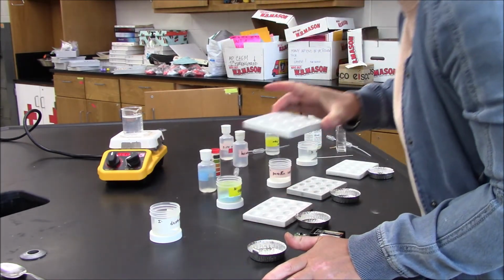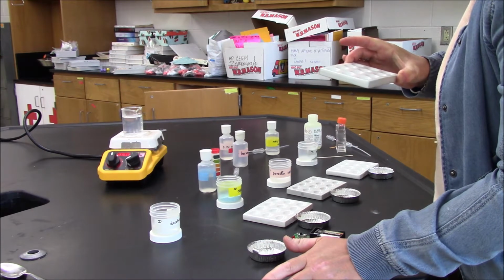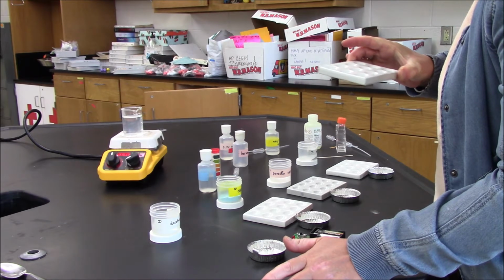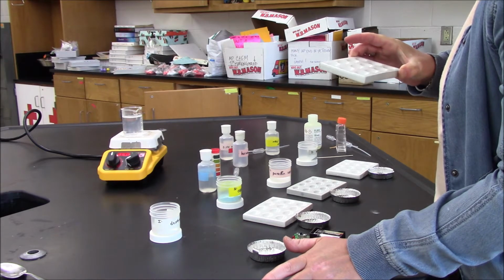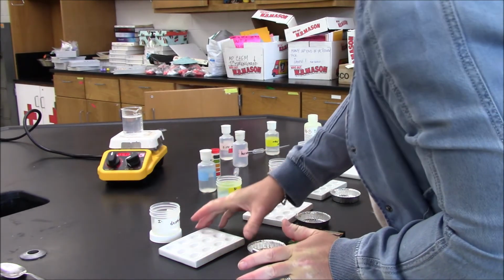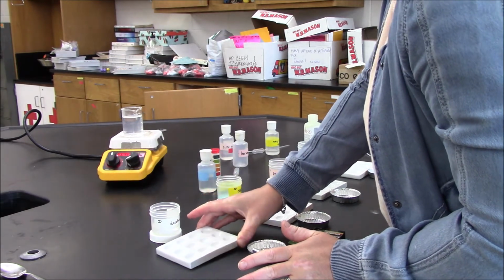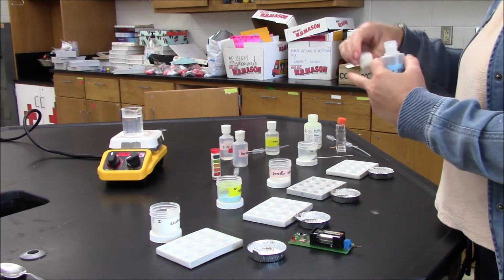And it might, because this is water-based. Giving it a minute. I can say that it dissolves, but that it does not react. Now we'll try our base.